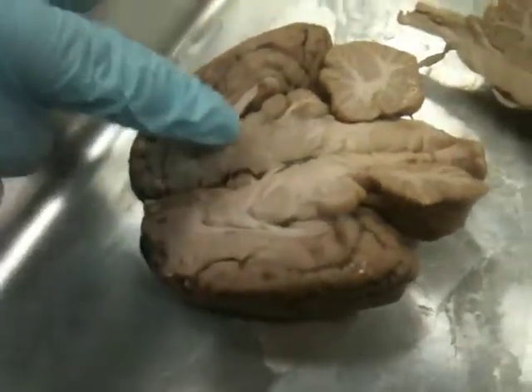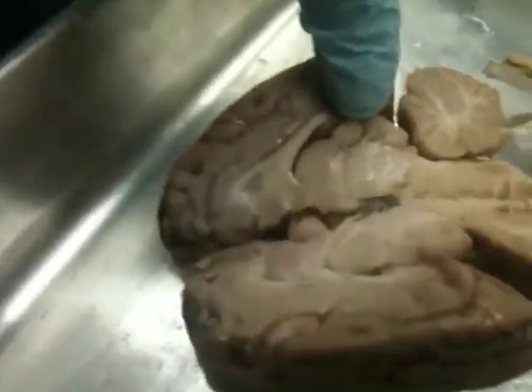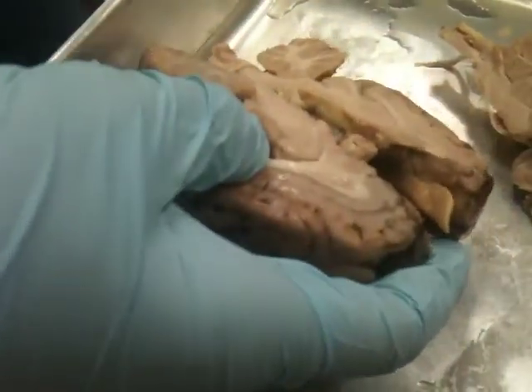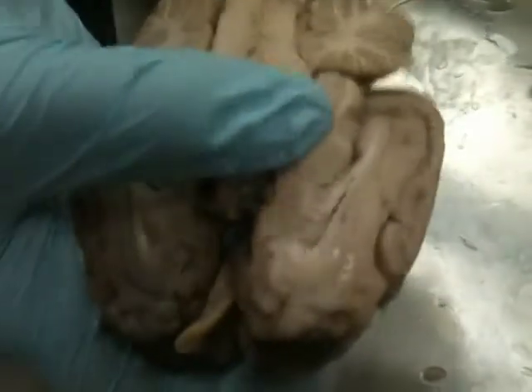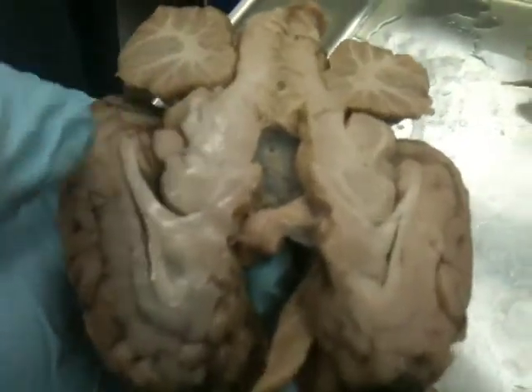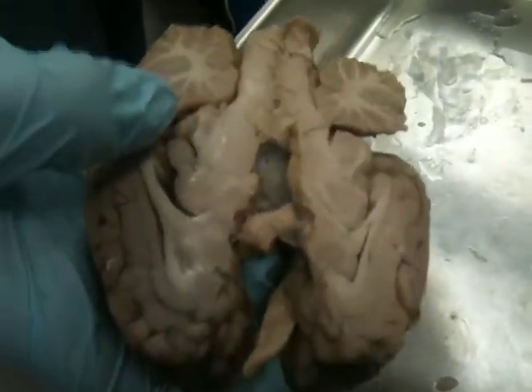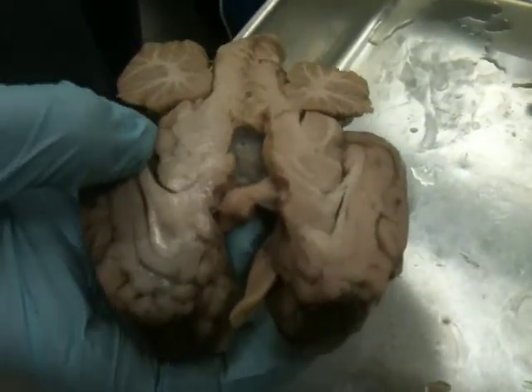Okay. And coming off the back of the thalamus, we have this, see this little flap right there? Yeah, so see this flap coming off? A lot of times it comes off only on one side, right? It's not on the other side because it all came off on this side of the brain. But that's the pineal gland, so it's coming off the posterior and superior part of the thalamus, the pineal gland.